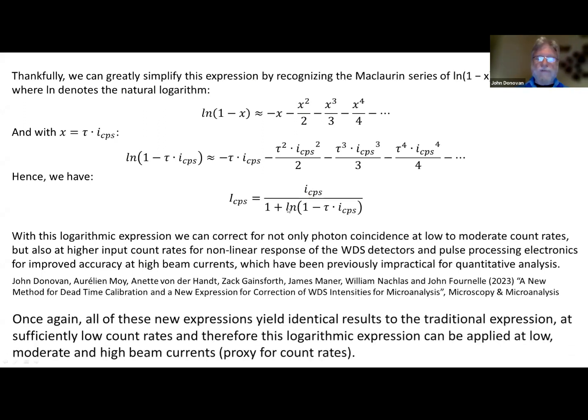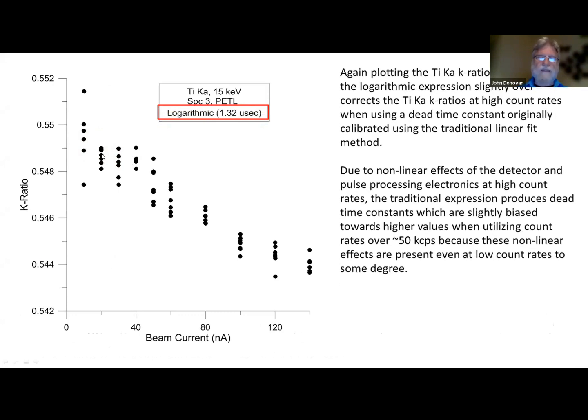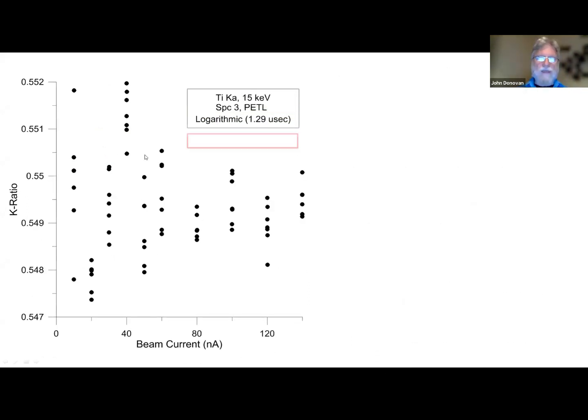If we use this function, we get the same results at low count rates, but we get much better response. And if we apply it here with the JEOL linear calibration at 1.32, we're slightly overcorrecting. The values at the low end haven't changed, but at the higher count rates, we're overcorrecting a little bit. That's because dead time is not a constant, it's a parametric constant, and depends on the form of the expression you're using to fit it. And so if we apply 1.29, just 3/100ths of a microsecond smaller, we get a perfect fit. Now our dead time calibration is within our counting statistics.